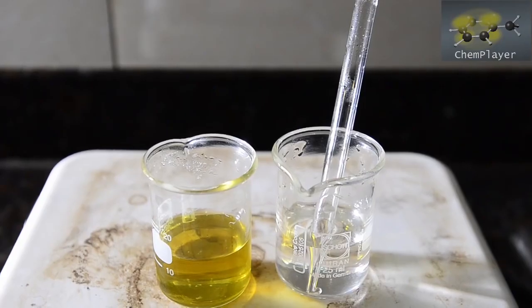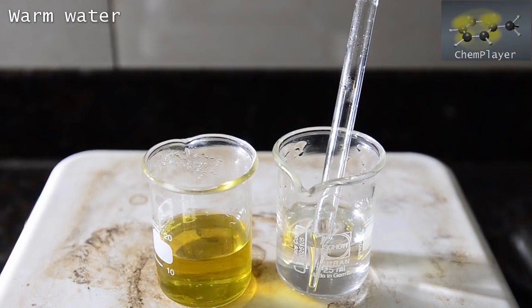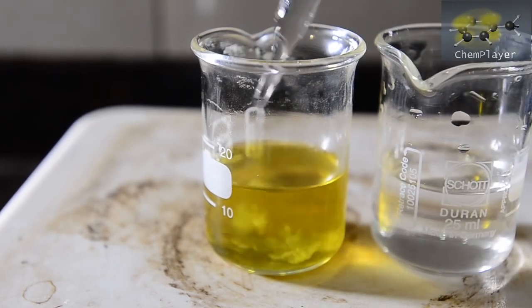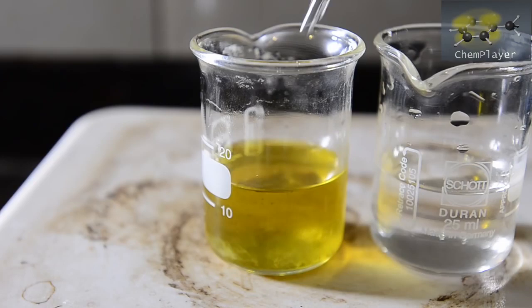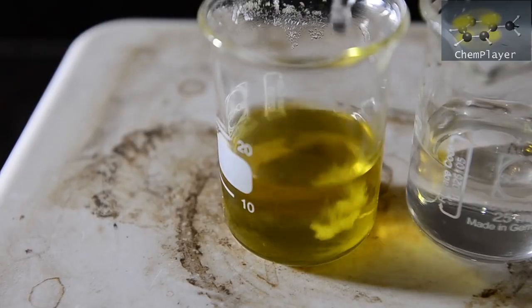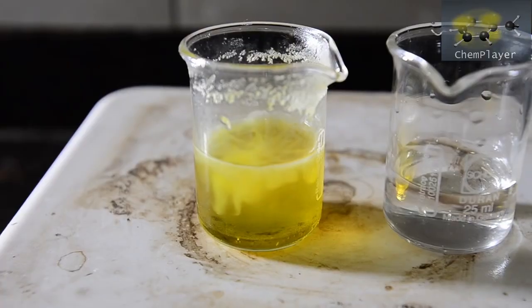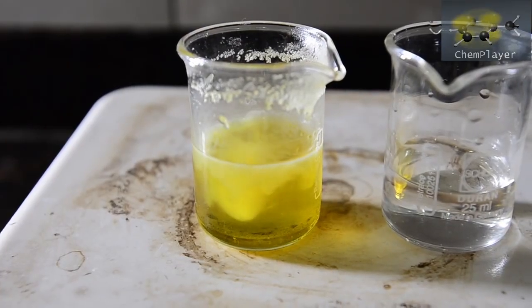Now we're going to slowly drop in some water. This will reduce the solubility of the product in the mixture. Soon we've got a permanent cloudiness forming in the mixture.